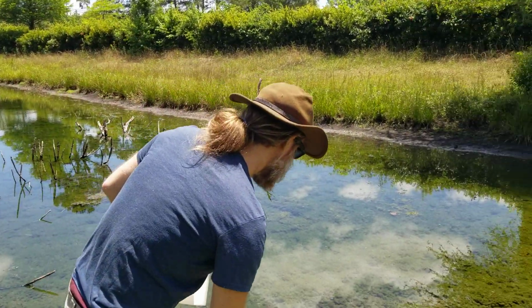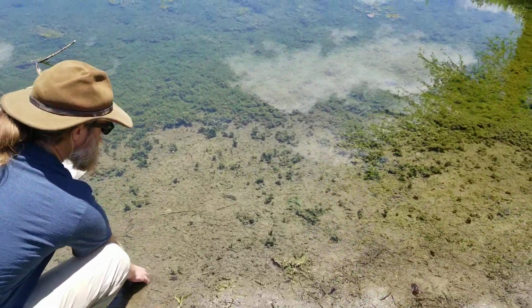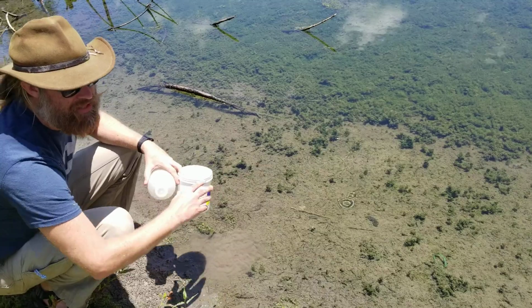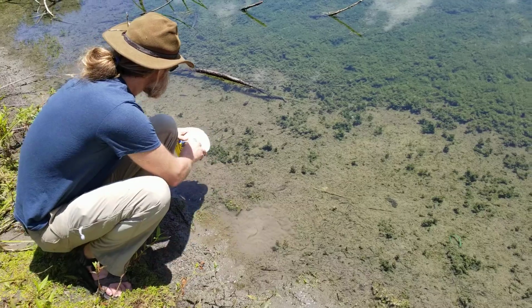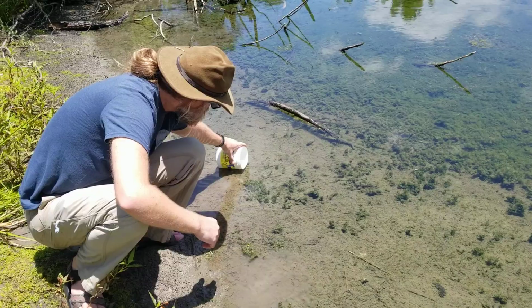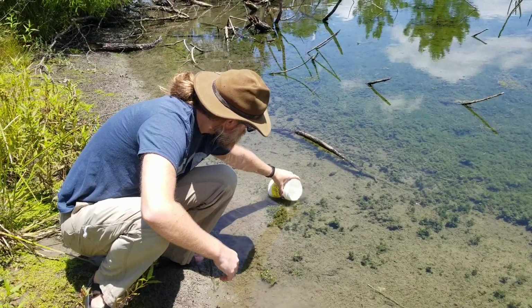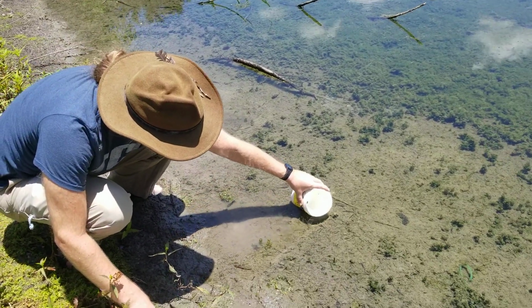If we look at the bottom or the surface of the pond, it's pretty mucky. I'm guessing it has a clay bottom, definitely not a sand bottom, but we want to be careful, again, taking the turbidity so we don't bring any of this sediment up before we actually measure that value. So what I'm going to do is just very gently get some water into this bucket here. Of course, now I got up some sediment, so I'm going to move over here just a little bit and finish this task.